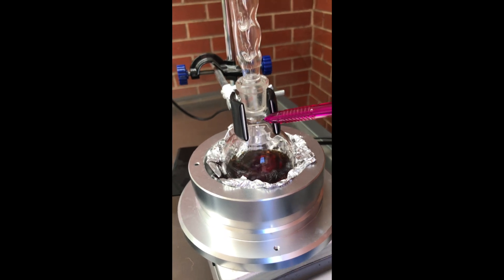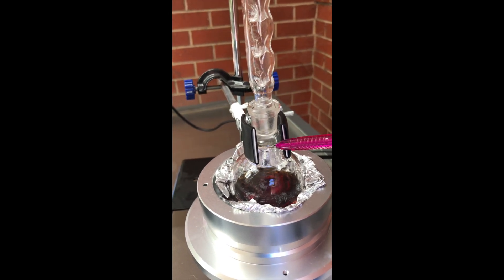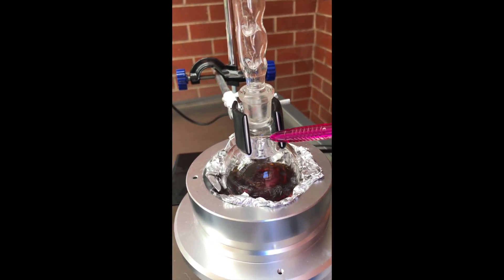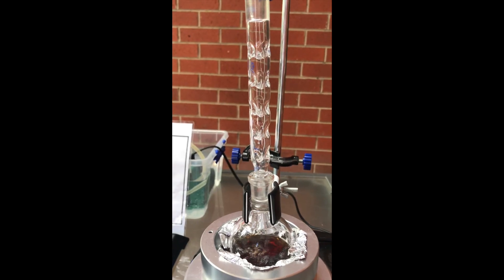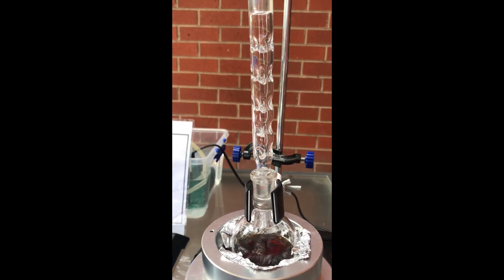Here is the beginning of the vapour trail soon after was followed by drops. As the drops became more frequent I put some aluminium foil over the fractional condenser to insulate it in order for it to heat up faster.